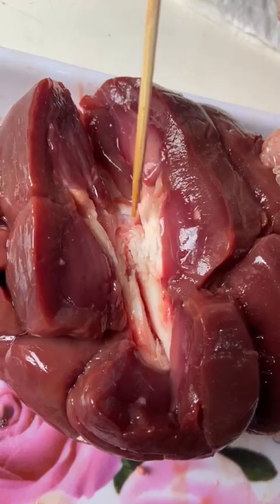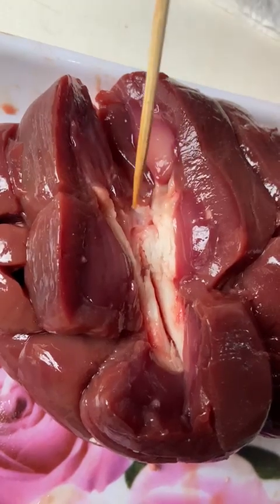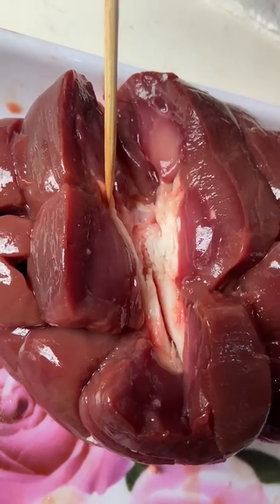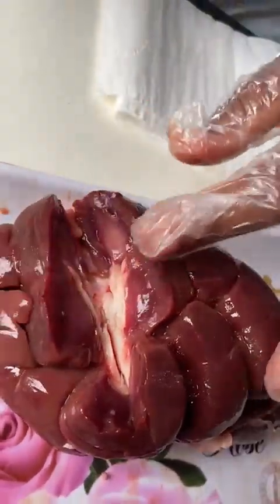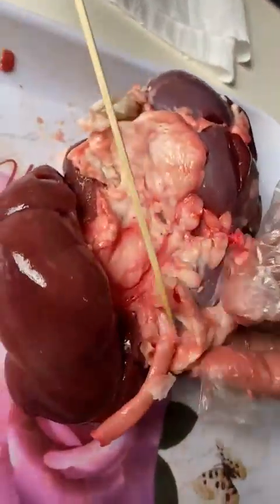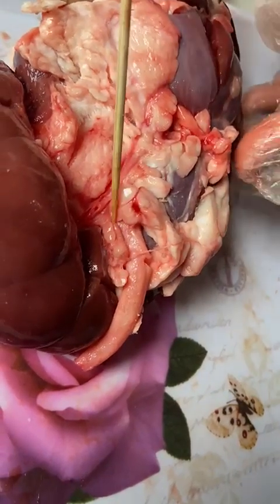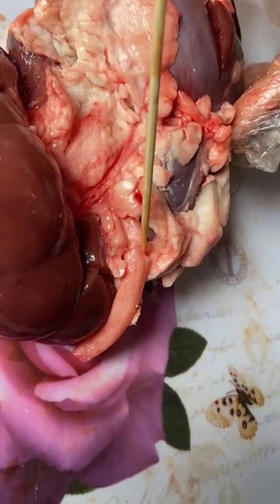And just after there, we can see the renal pelvis. This area is the funnel-shaped structure. It collects urine and channels it into the ureter. The ureter on this side is not visible. I am going to turn to the other side of the kidney, and we are going to observe the ureter. This is the ureter. The ureter carries urine from the kidney to the bladder.